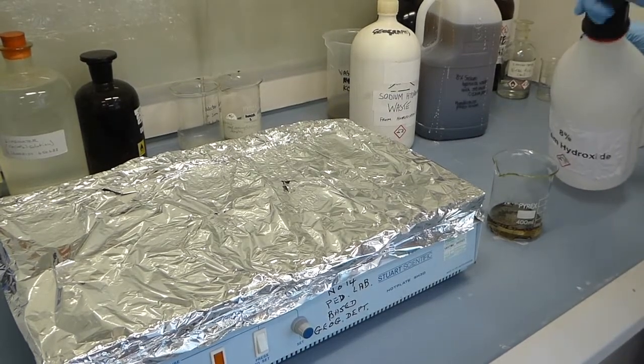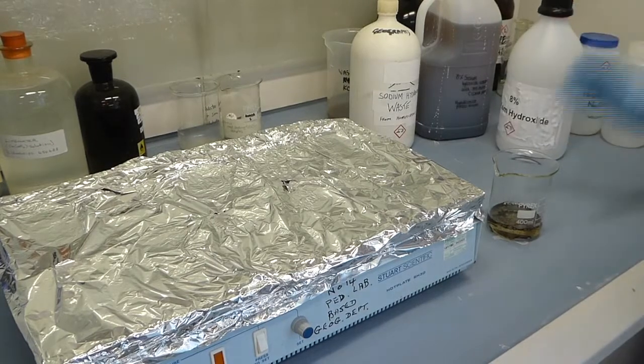You then want to place that onto a hot plate to simmer at 95 degrees for an hour.